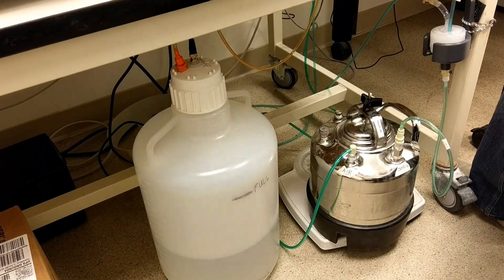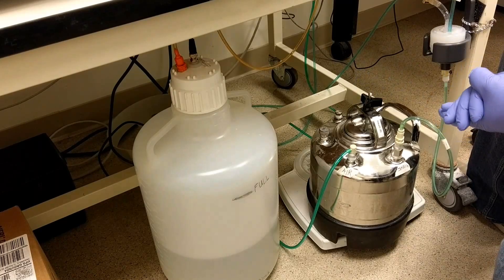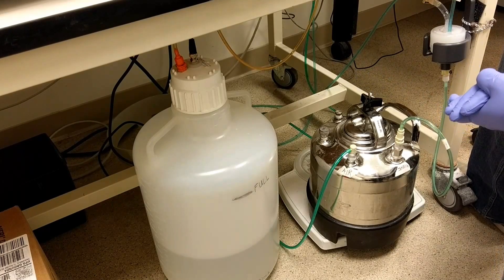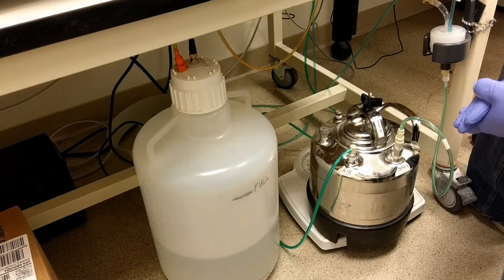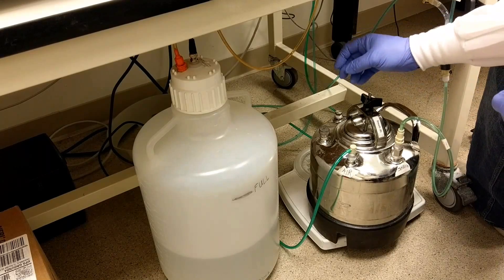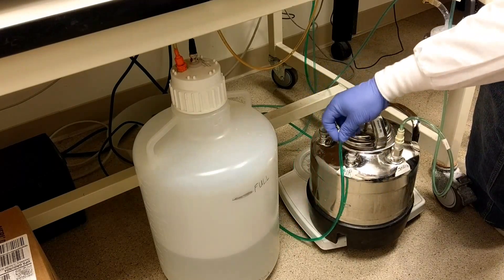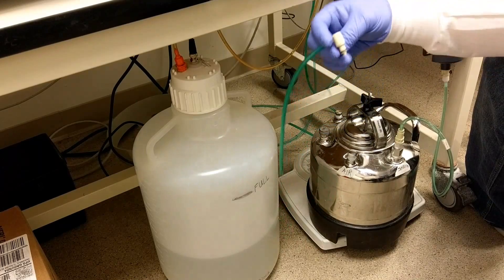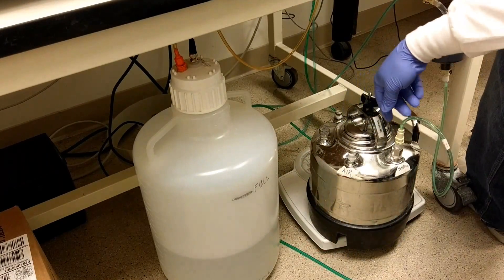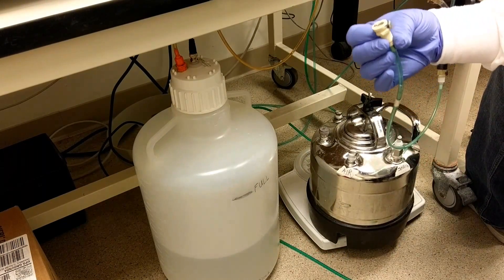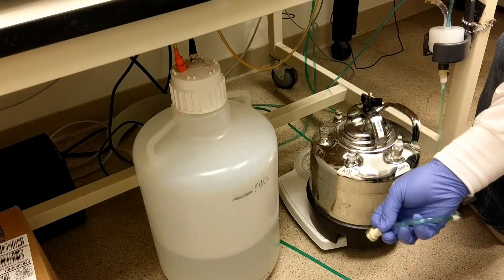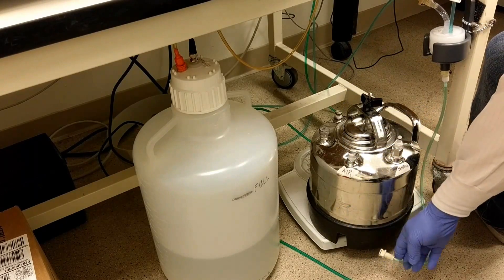To refill the sheath tank, you want to make sure your instrument is on standby mode so nothing is running. You have to disconnect two lines: the airline by pressing the tab - it'll release and this has a male coupling - and press the tab on the sheath line and that will release, and that has a female end to it.